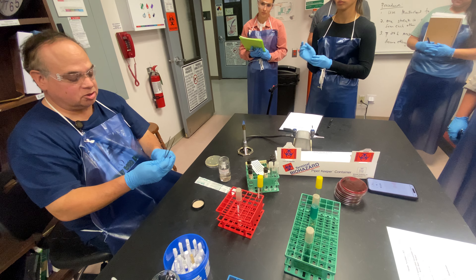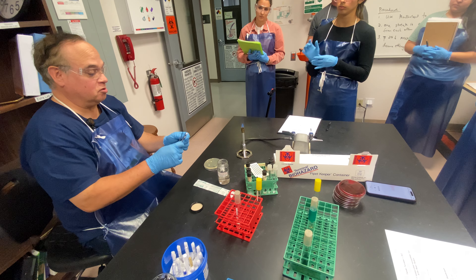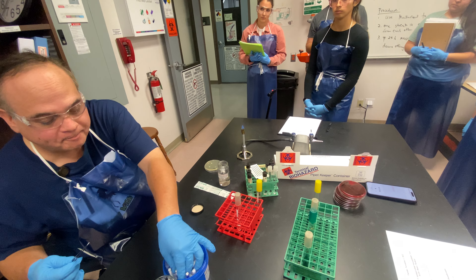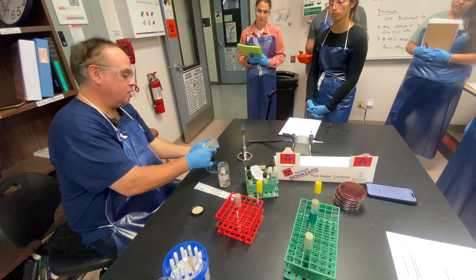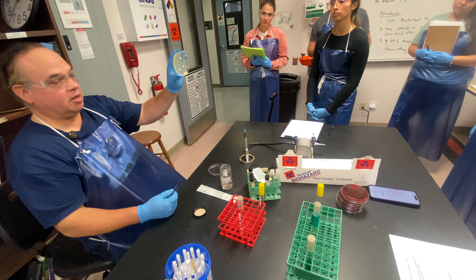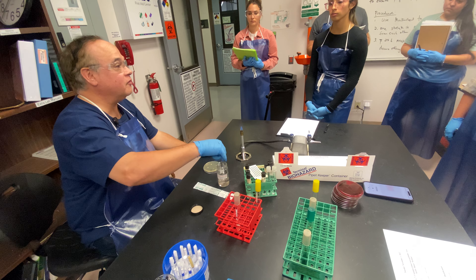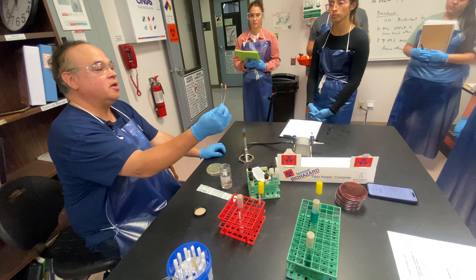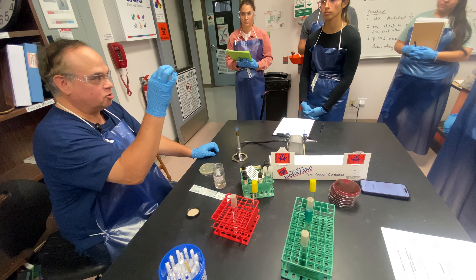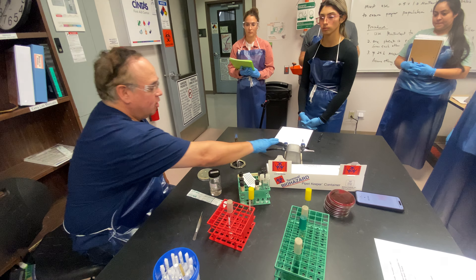The next antibiotic I've selected is nalidixic acid. I'm going to put this on the plate equidistant from each other. I could put more, but I think that's plenty — this is a teaching lab and we're all just learning how this stuff works. I'm going to flame the tweezers one last time, and remember: safety first. Never place hot tweezers into the alcohol. So I'm really done with the flame — I'm going to go ahead and turn that off.